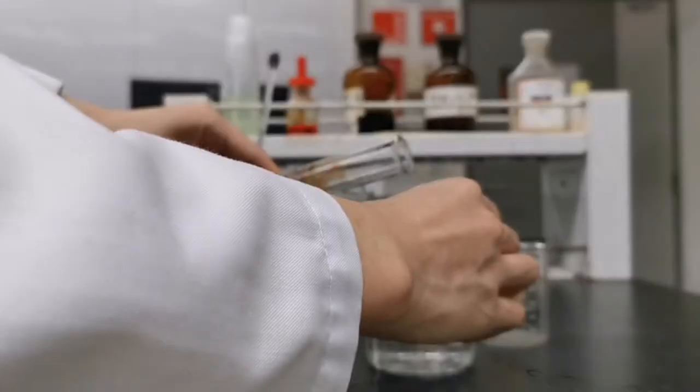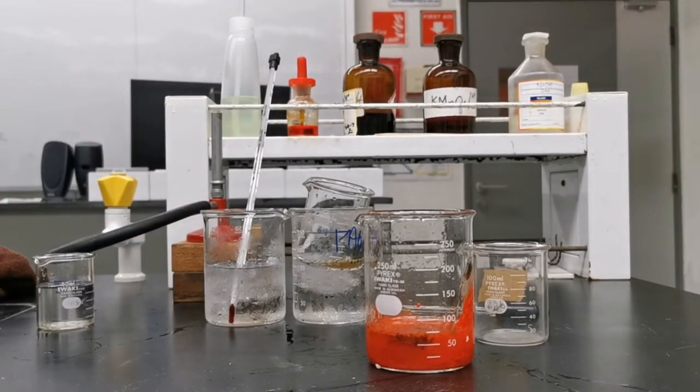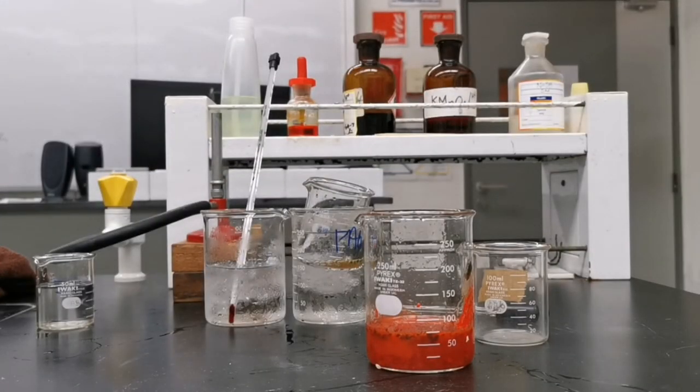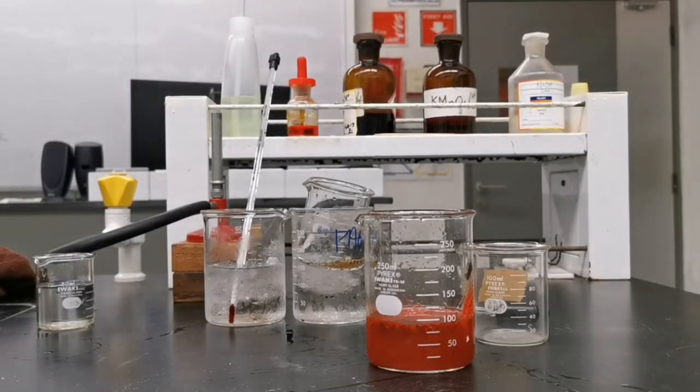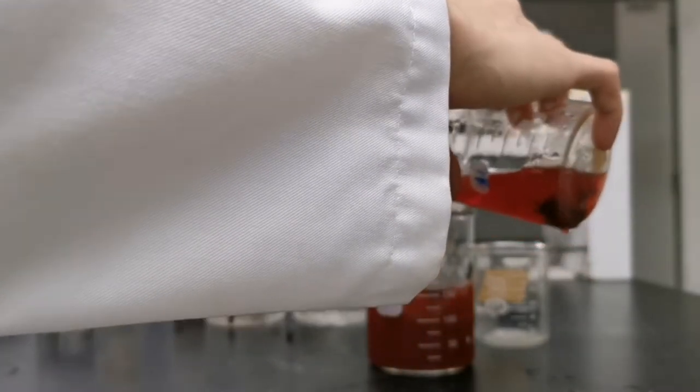I then transfer my result from my second run into a large beaker with 50 ml of distilled water, and I wash it a few times to get all my results into the beaker.